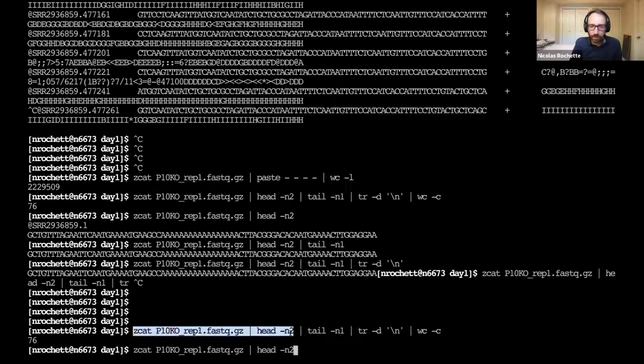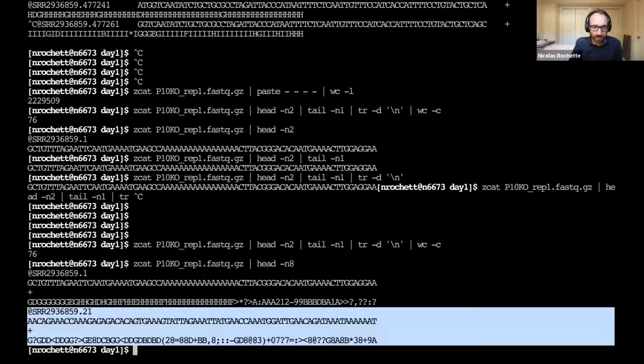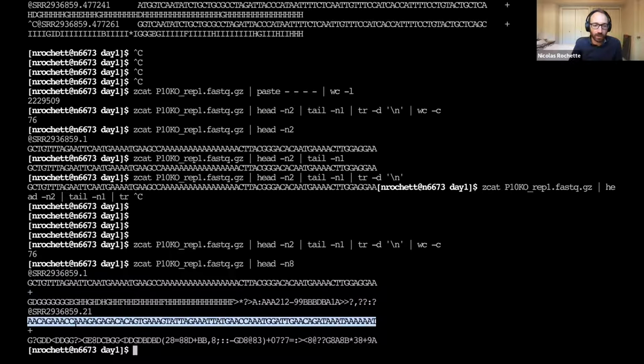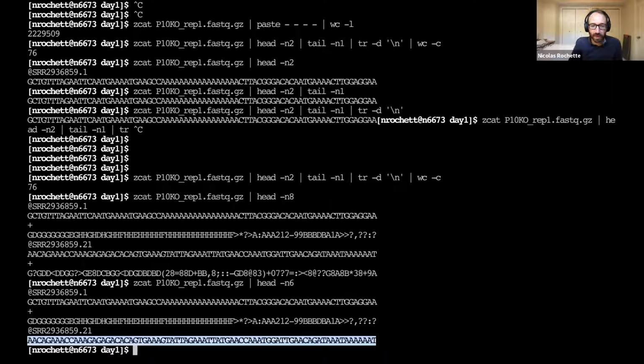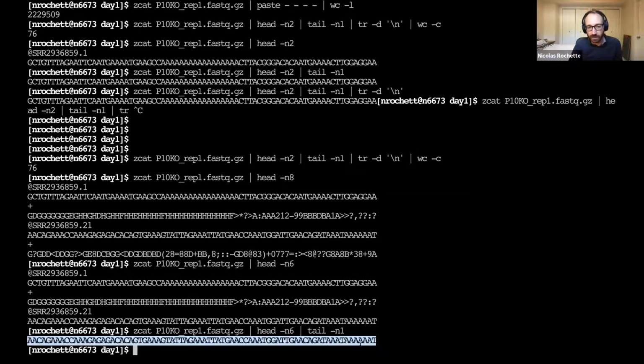If I wanted to look at the sequence of the second read, so these are the first 8 lines, right? The first 4 lines are the first read. The second line is the first read's sequence. And if I wanted the sequence of the second read, I would take 4 plus 2. So that's going to be the sixth line. If I'm doing head -n 6, then the last line is my second sequence. And then I can just extract the last line again. So before I was doing head -n 2, tail -n 1 to get the second line. And now to get the sixth line, I do head -n 6, tail -n 1. And then I get the second sequence.